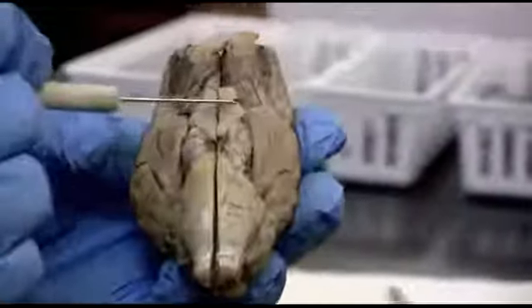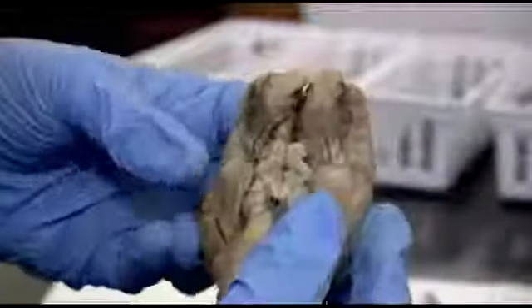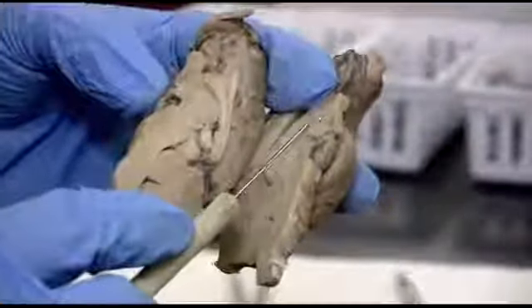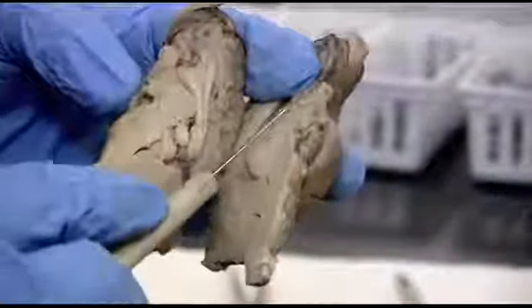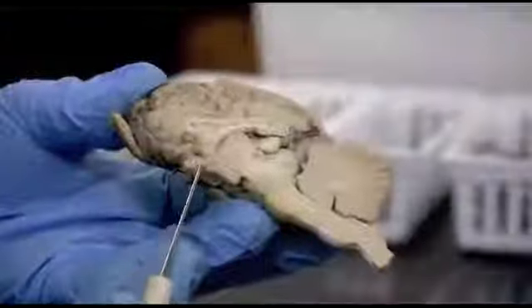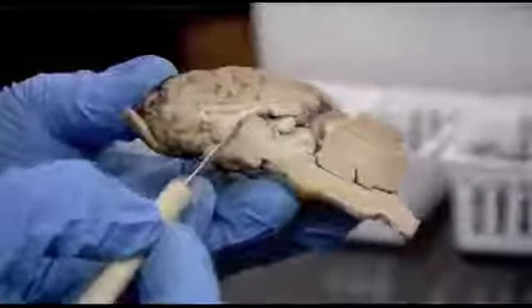The optic chiasm here is going to be your landmark to tell you right behind it is the infundibulum, and therefore if we open it up, right in those locations is where you'll find the hypothalamus, the big round thalamus above it. So here's that optic chiasm cut again, the mammillary body. In between is the hypothalamus. Above it is the thalamus.